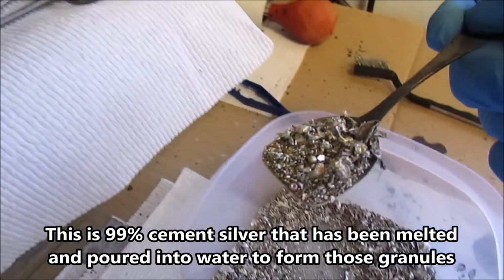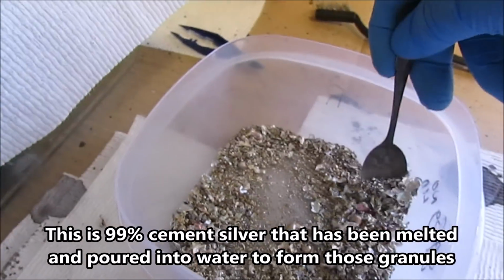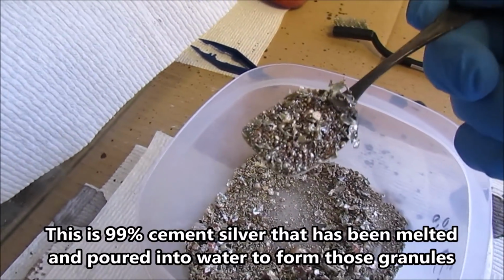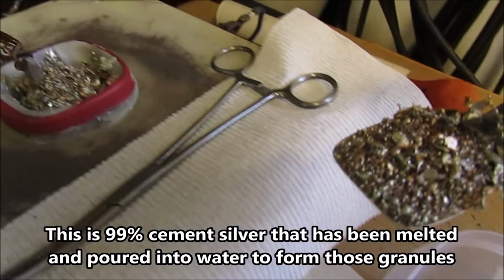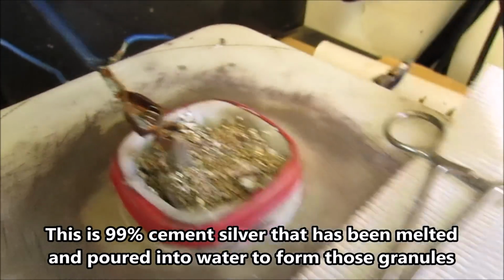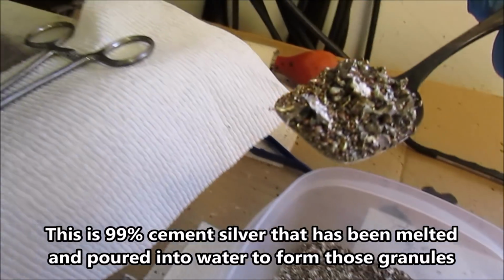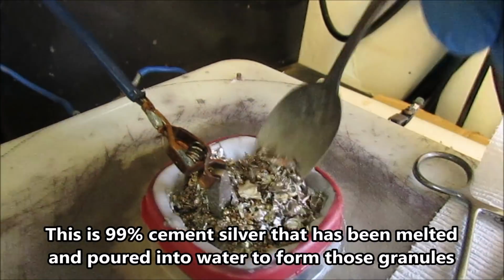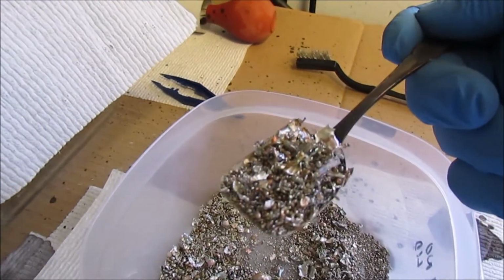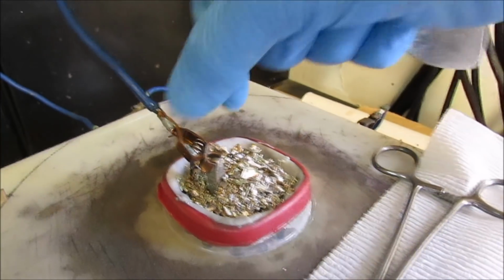The cell consumes about 5 troy ounces of impure silver per day and turns it into pure silver crystal down inside the silver cell there. That should do it.